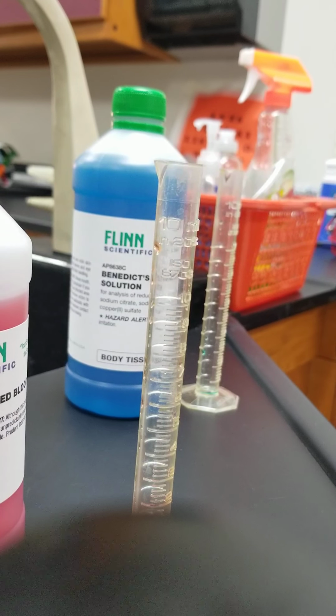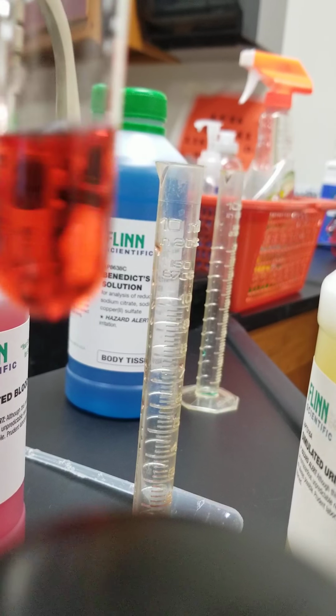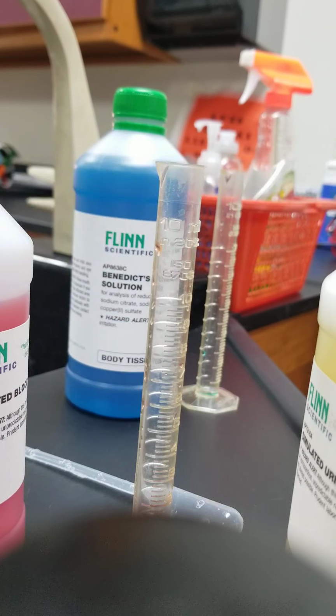So on this last test, we're actually testing for the presence of 2 ions, sodium and potassium. Those hopefully sound familiar from your chemistry class. It's been a while, but hopefully we remember those terms. Okay, so what I did was I took some blood and I put it in a test tube. And now we are going to do what's known as a flame test. So a flame test is exactly what it sounds like. I am going to take that same blood that I just showed you, and I'm going to expose it to a flame, so to fire. I'm just going to use a candle to do that.